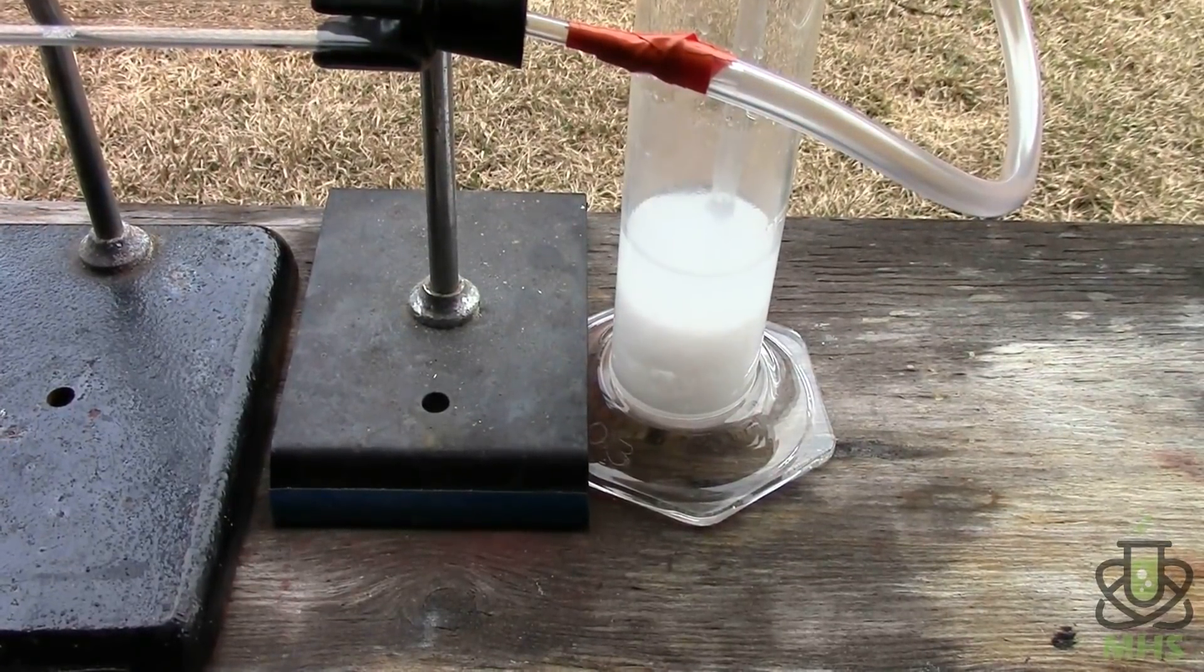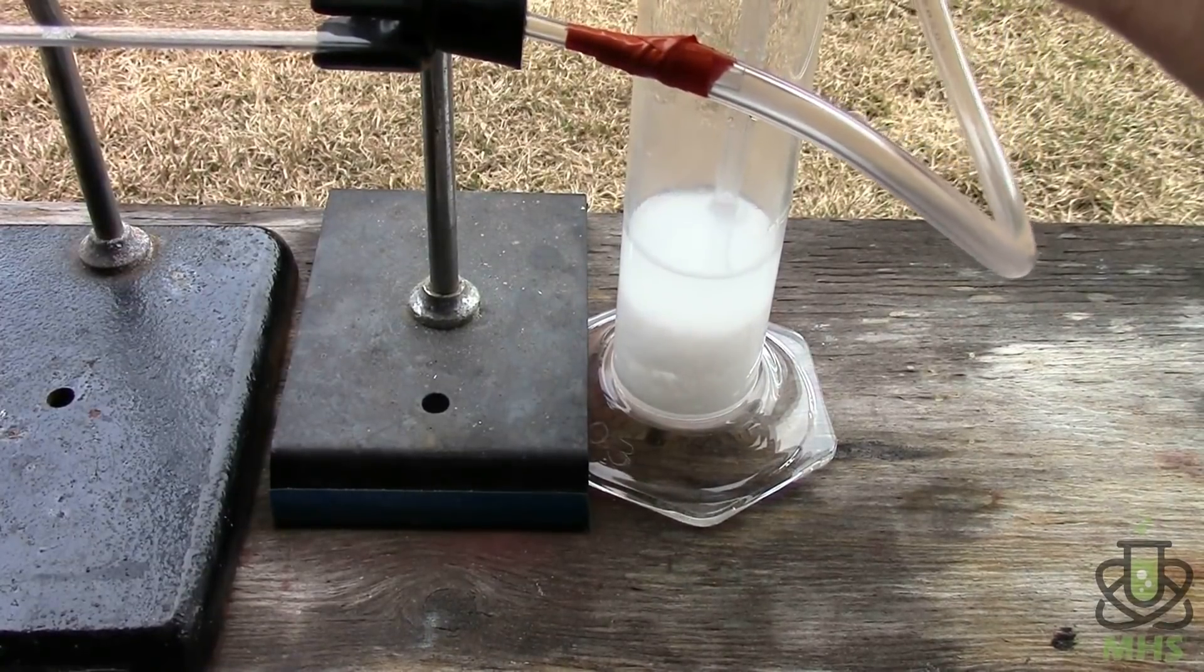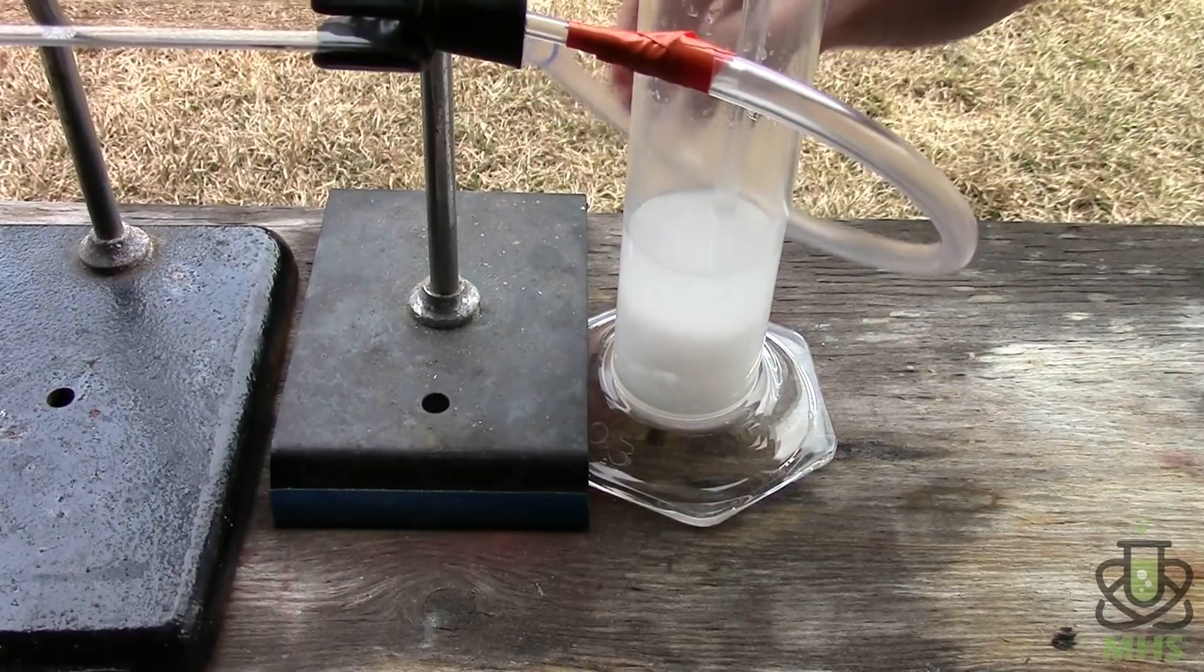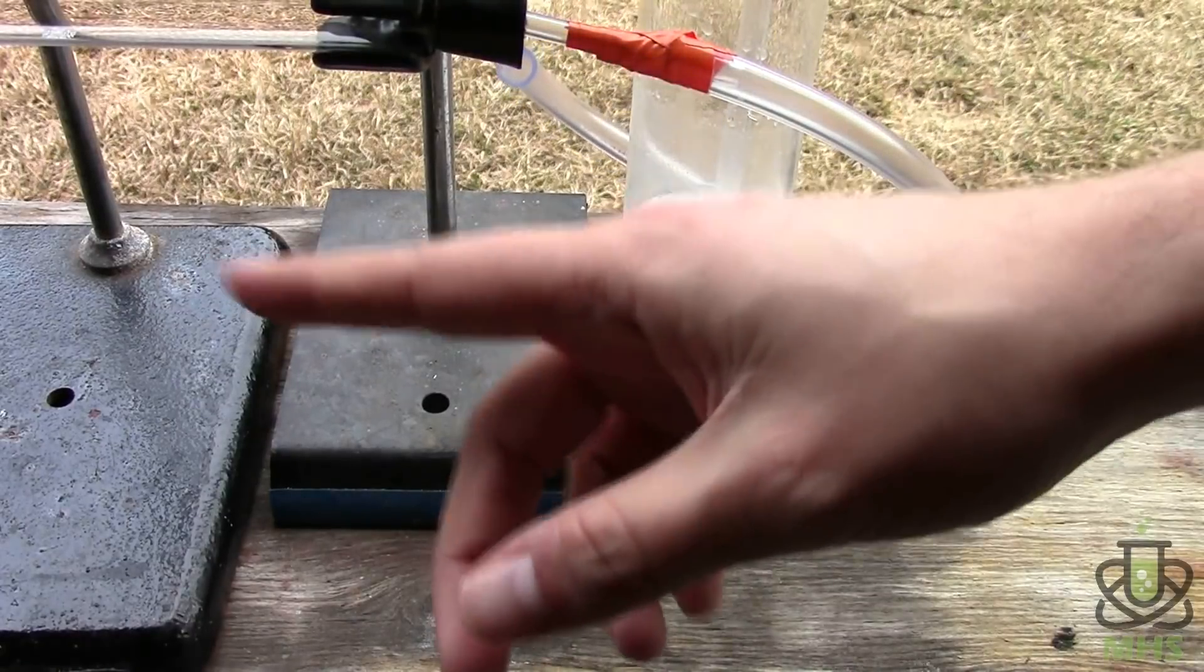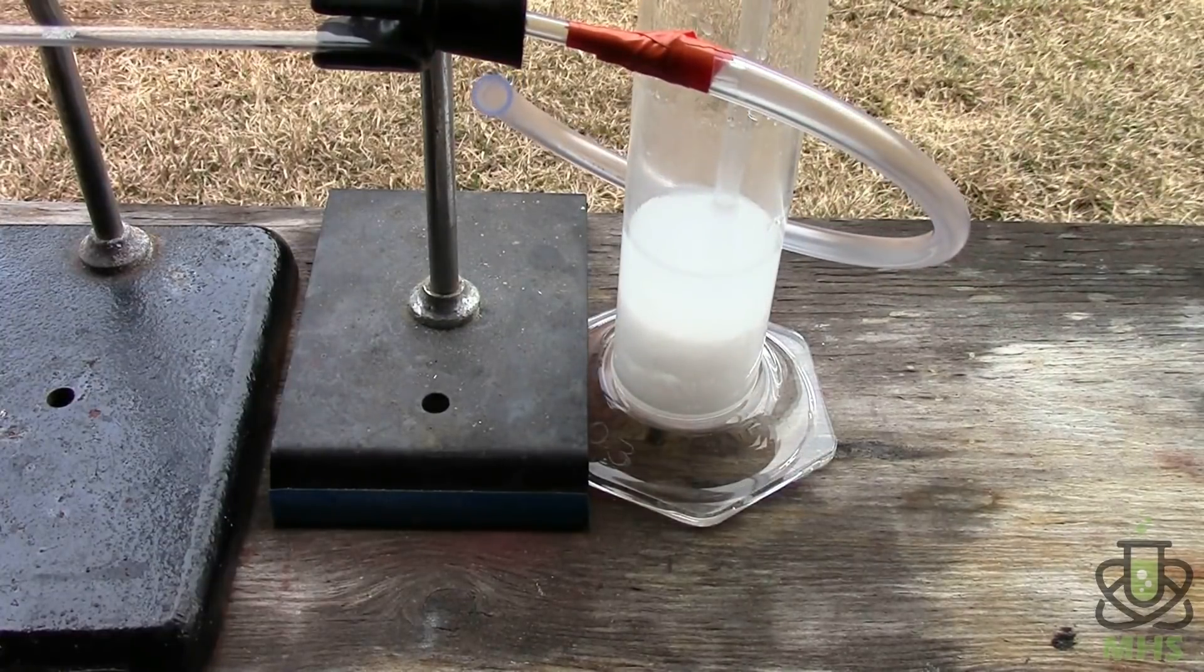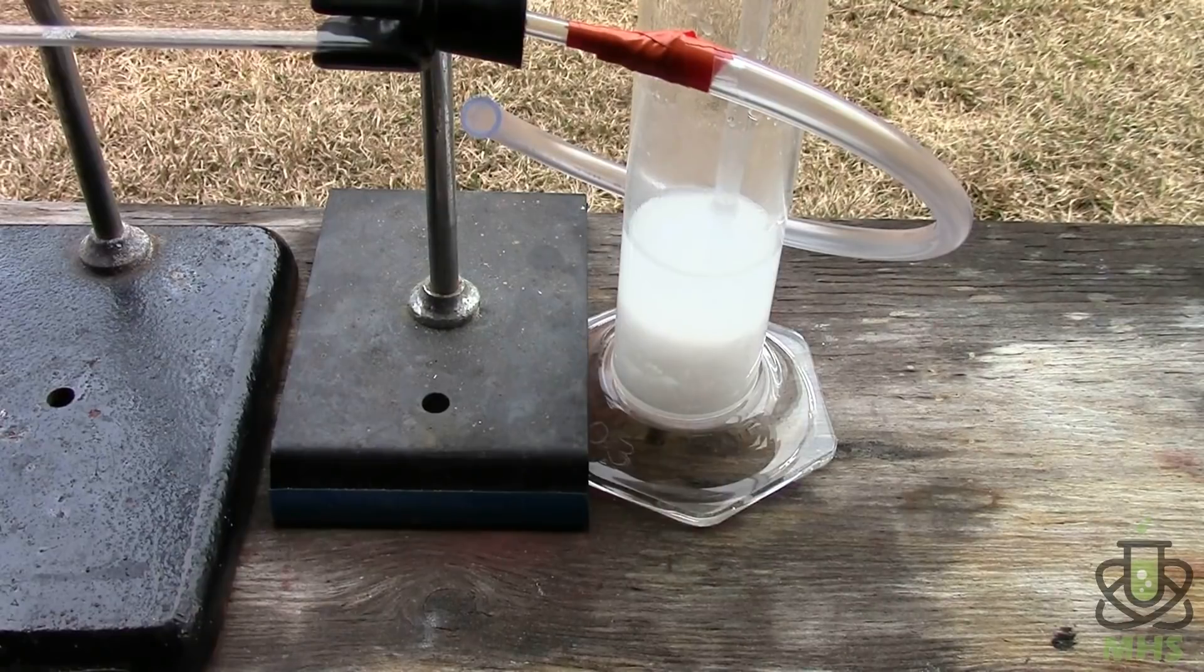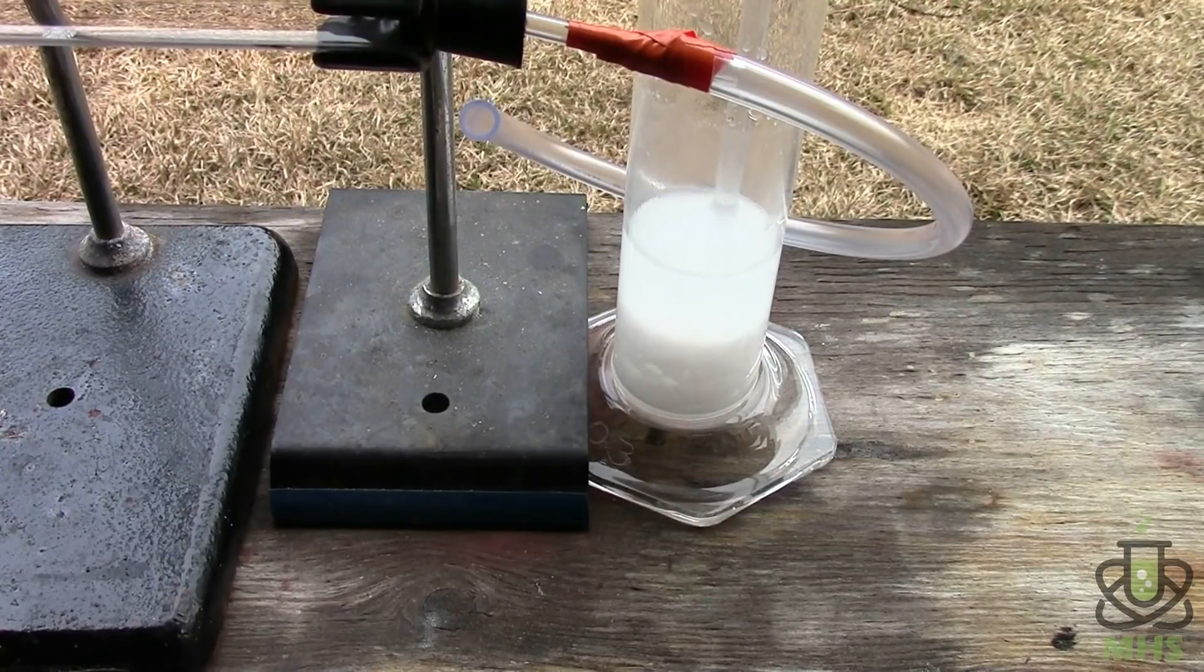Something else I need to do is decouple this from the wash bottle here, because if I leave that tube on there, the interior of the quartz is very hot, so as it cools down, it might pull water up through this tube, and that would be bad. So let's let this whole setup cool down, and then we'll take it back inside, and I'll re-weigh the diamonds and see what happened.